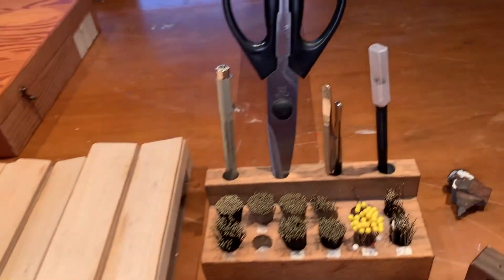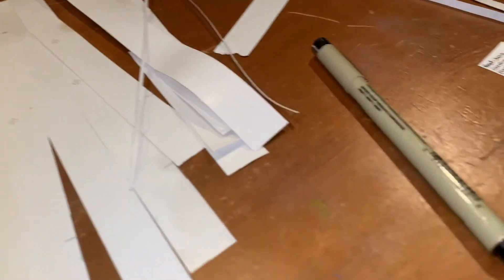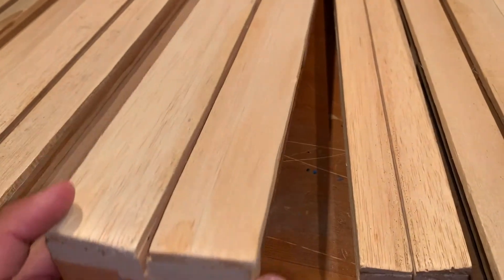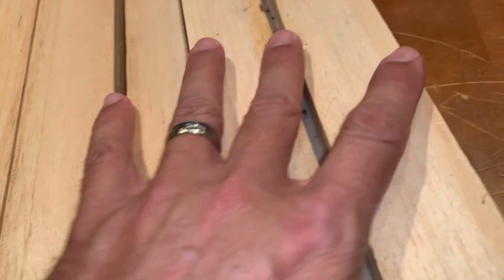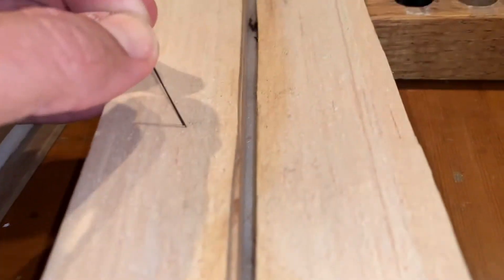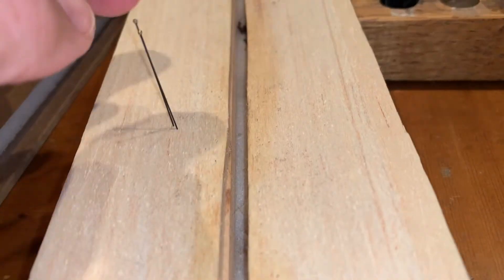We're going to go over the materials you'll need to properly curate a Lepidoptera specimen collection. First, we need our mounting boards. I'm a little bit handy so I actually made some of these myself, but they've got to have the right spacing and the right pinning bottoms. I like using balsa wood as the surface on the top of my boards — it's stable and sturdy enough where the pin doesn't fly away when you hit it, but soft enough where you can put the pin in without crushing your fingers.